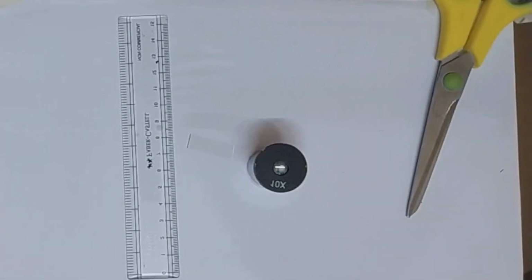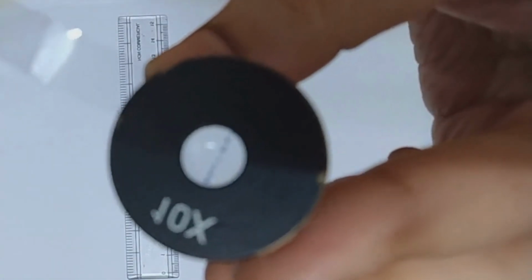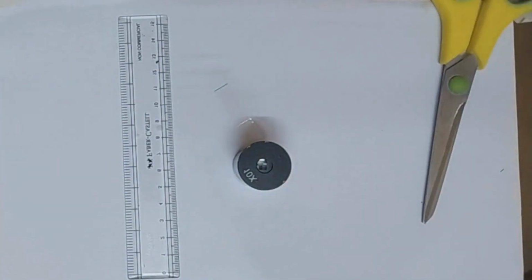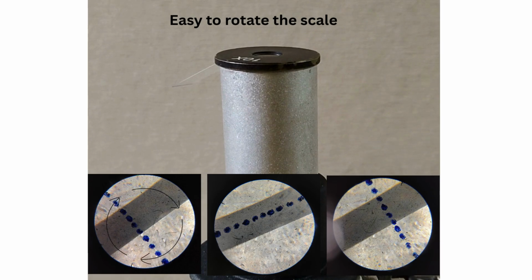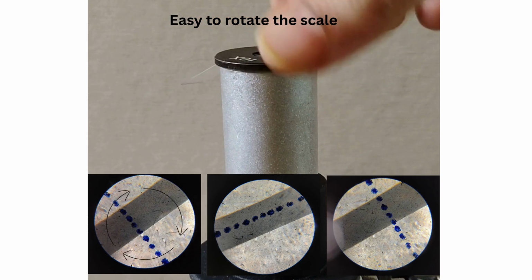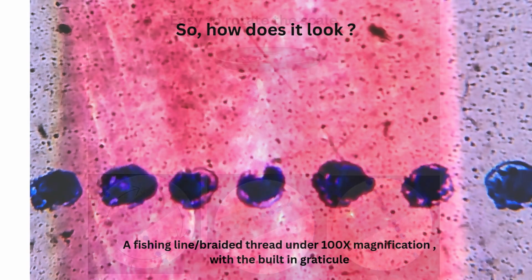If you have access to an advanced microscope, it is likely to have a graticule holder installed just outside the field lens, so check with the manufacturer. As you can see, I can rotate the graticule for easy measurements. And here is how a fishing line or a braided thread looks like with a built-in reference graticule. I've used light from above.